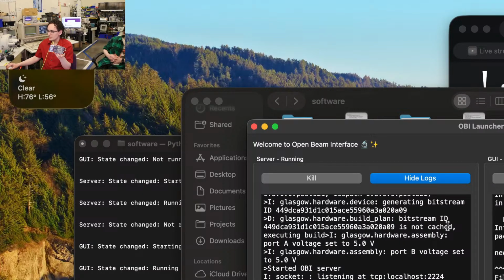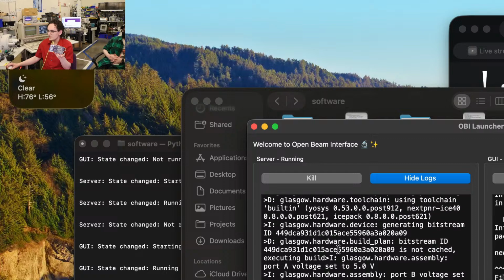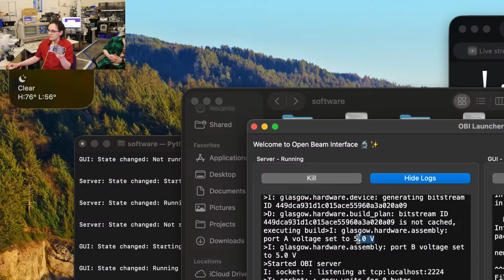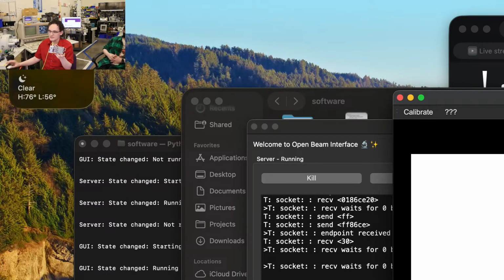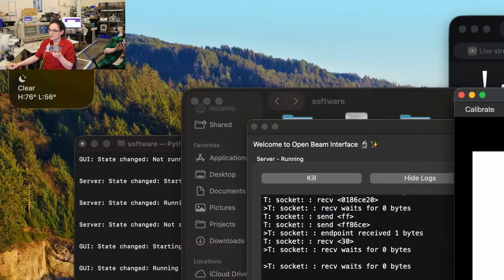So it wrote the bitstream. And a really good thing to look for is if the voltage is set. Once the voltage is set on the A and B ports here, everything's been done basically. And we've also got our server is running and our socket is ready to go. So from there, we can start scanning. Now we're not actually scanning because they're not plugged into the microscope yet. And that's what we're going to do next. So that is how you install OpenBeam interface software.